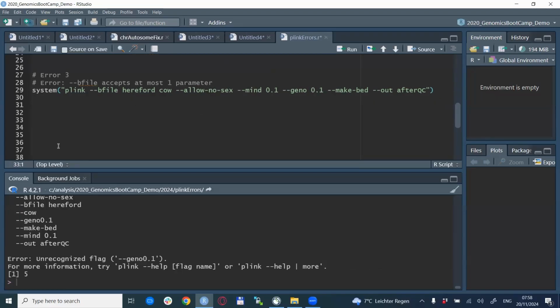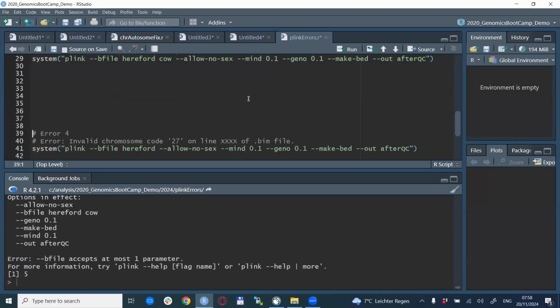The next error message that is fairly frequent is when PLINK writes out that one of the options accepts at most one parameter. So let us demonstrate this error, and you might already see what's happening. Indeed, this is --bfile accepts at most one parameter.